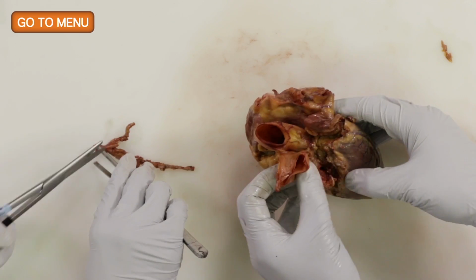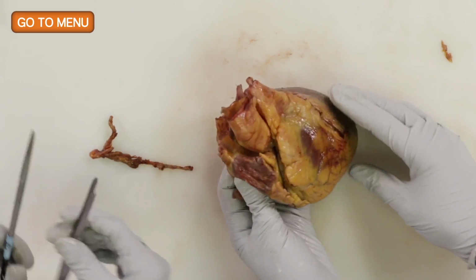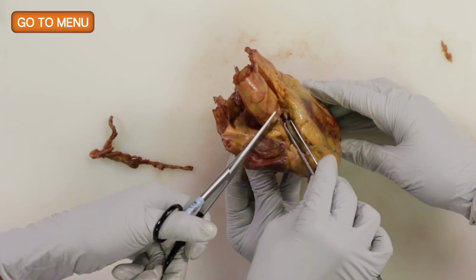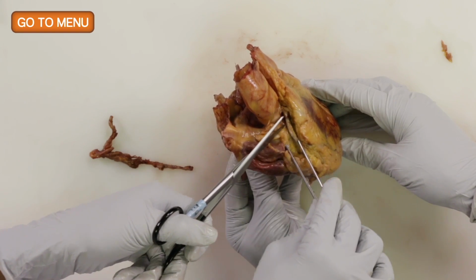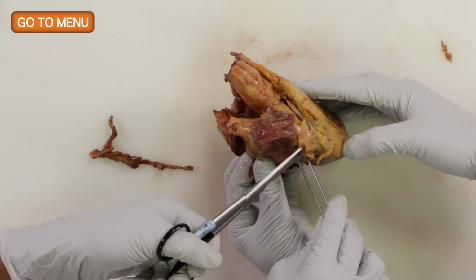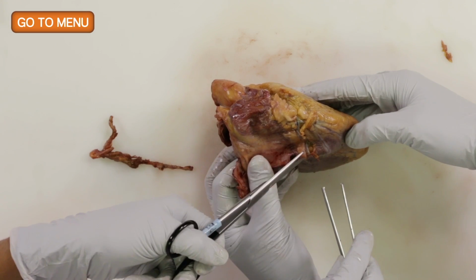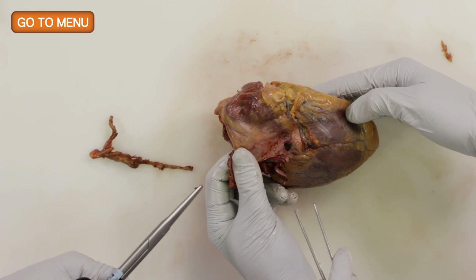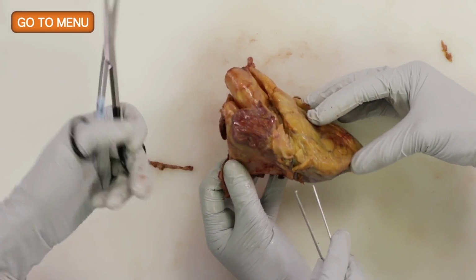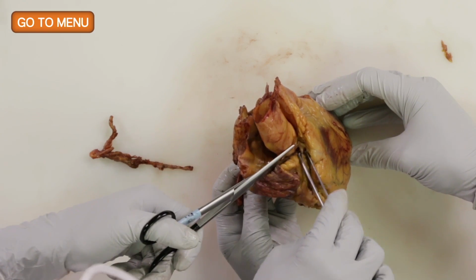So that's the left side of the circulation. And now the right. So again, starting at the ostia or the right coronary cusp, I dissected away the right coronary artery, came all the way around the right ventricle, and here you can see that actually it's the right coronary artery that is supplying the posterior descending artery. So it's a right dominant heart. All right. Excellent. So you want to take that off.